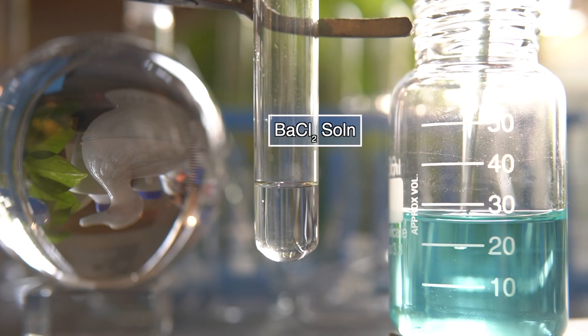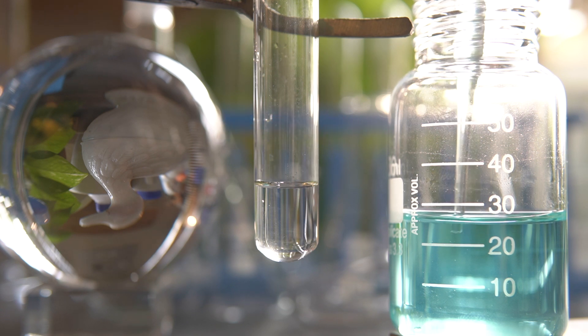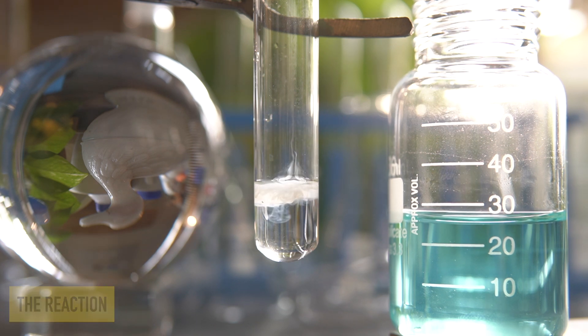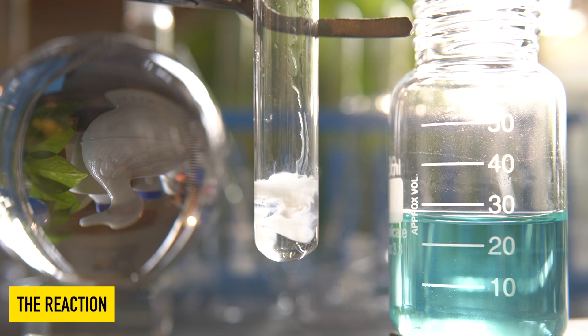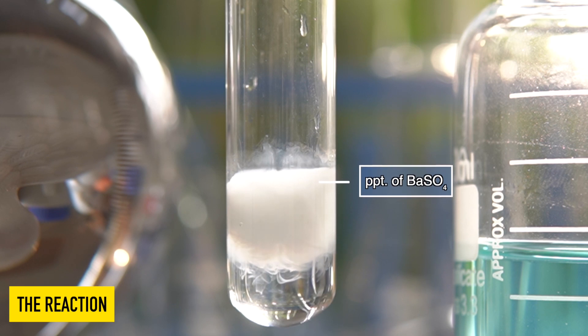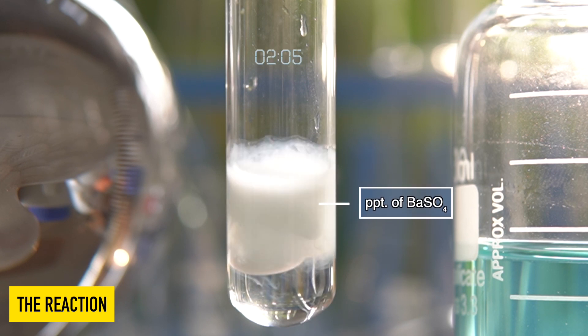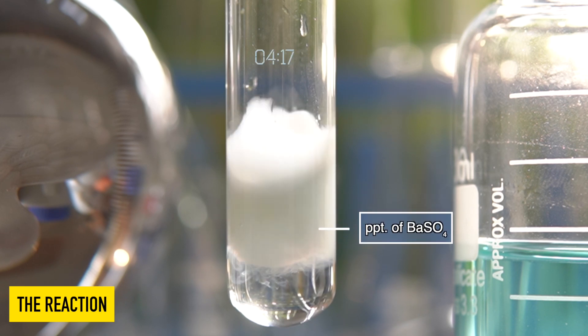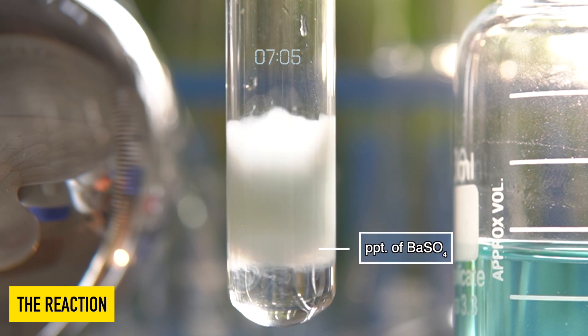Now we will add copper sulfate solution into the barium chloride solution and observe the effect.